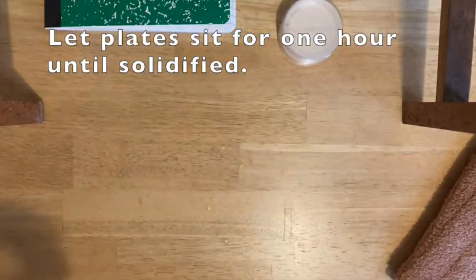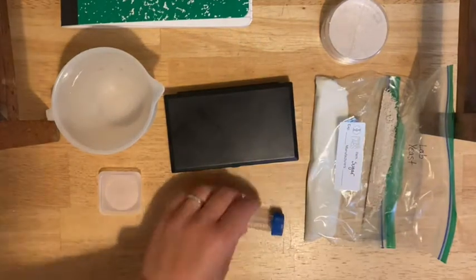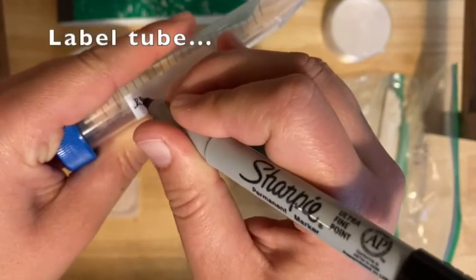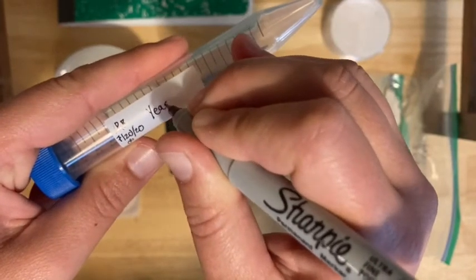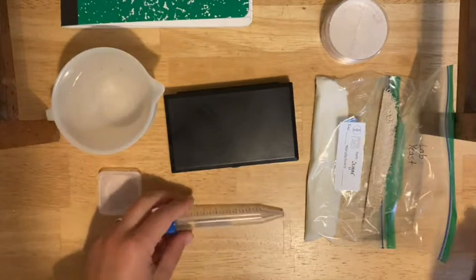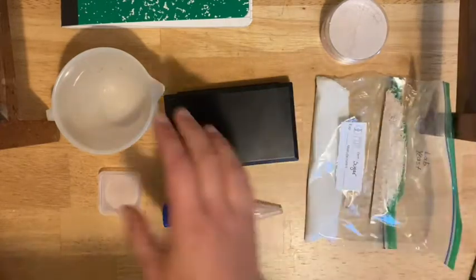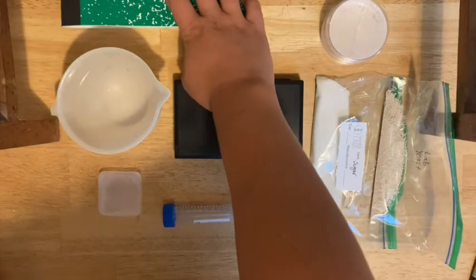Set these aside and let them cool while you prepare the yeast. Take another 15 ml tube and label it with your initials, date, period, and what it is — this is going to be your yeast solution. You've got to feed the yeast to get them grown, so we're going to feed them with sugar. Start by making a sugar water solution. You'll probably have a little packet of sugar like a restaurant packet, some yeast, warm tap water, a weigh boat, and your balance. The amounts should be in your notebook — make sure you're following along in your pre-lab.